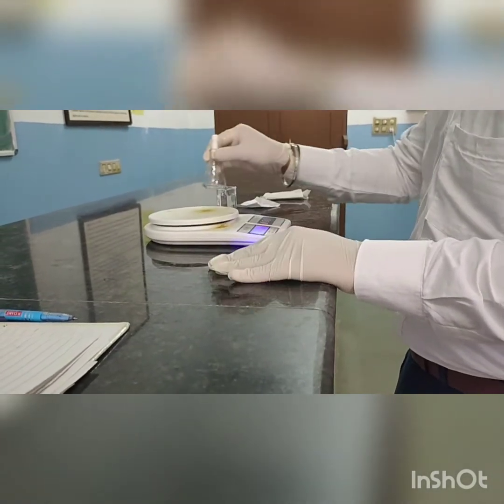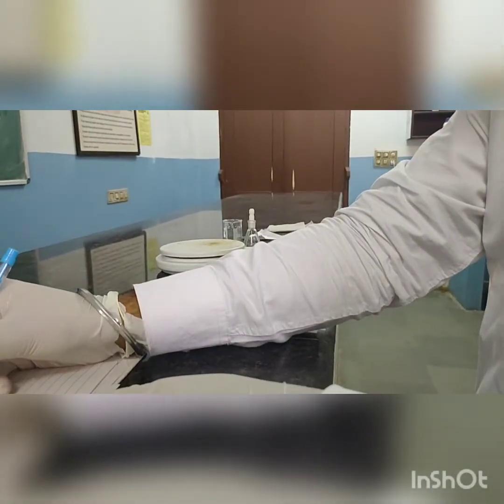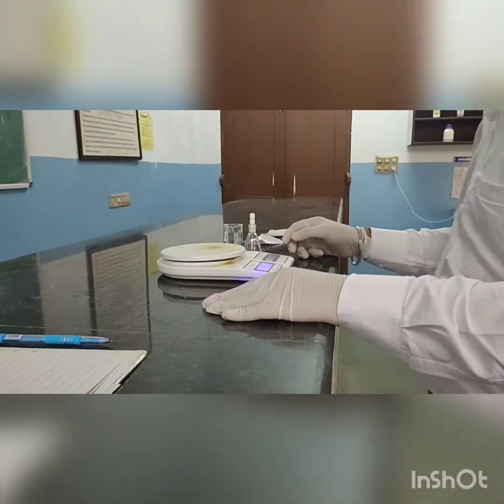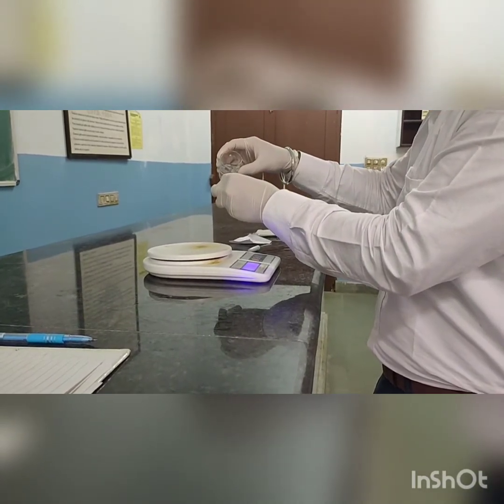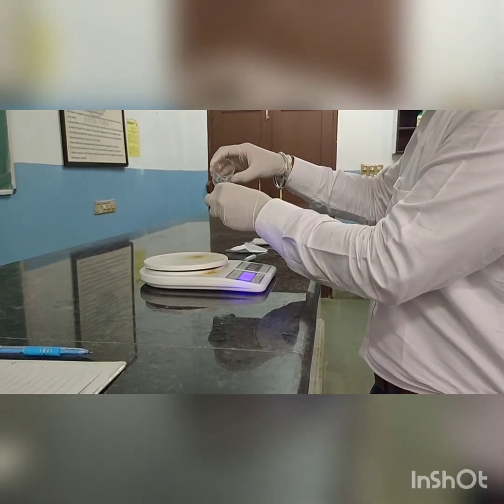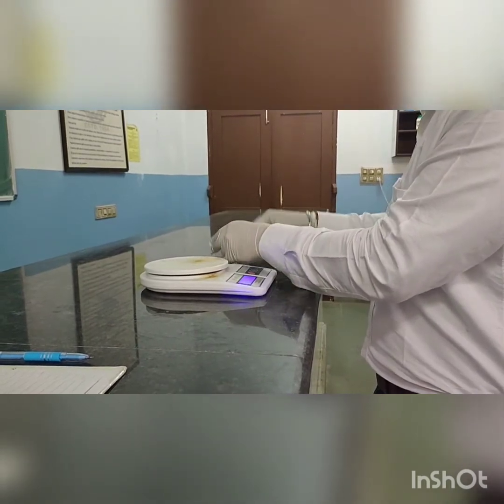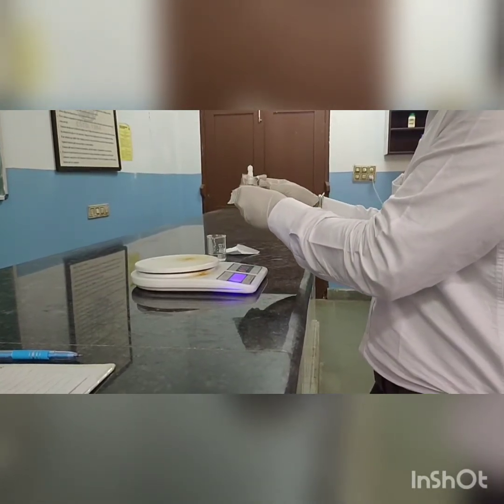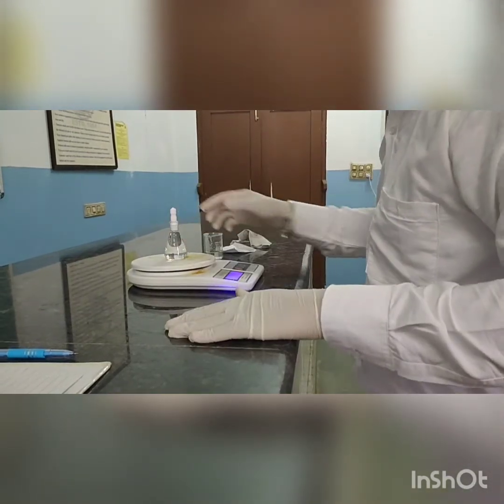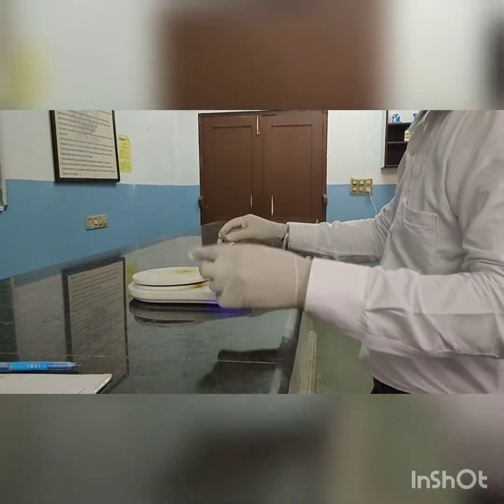To calculate the true density, we will first weigh the empty relative density bottle and note down the reading. Then fill the density bottle with water and dry it with the help of tissue paper, then again weigh it. The reading is noted. Then we will dry this density bottle in the oven.